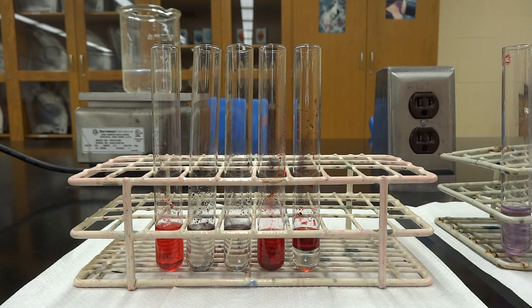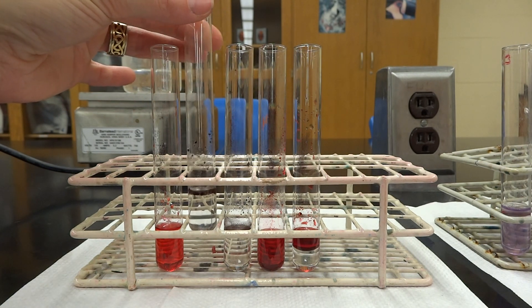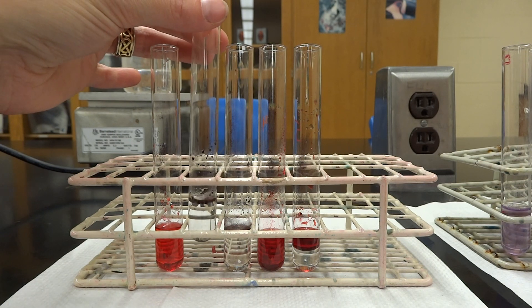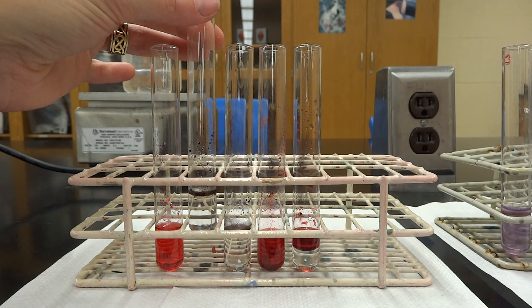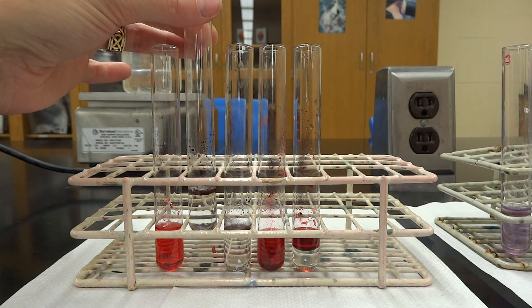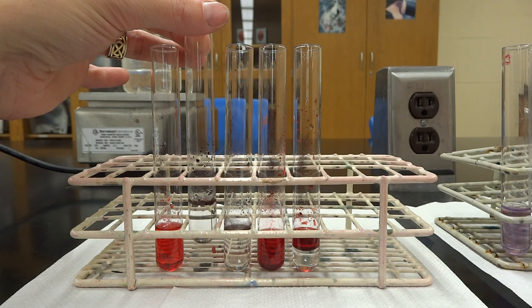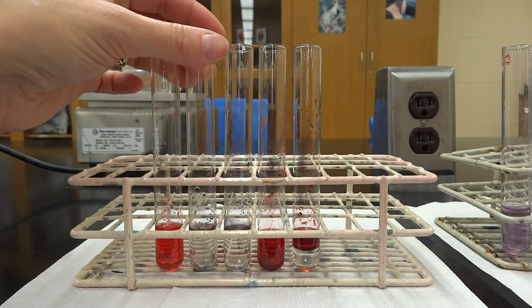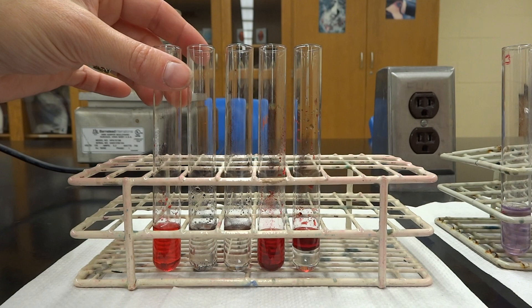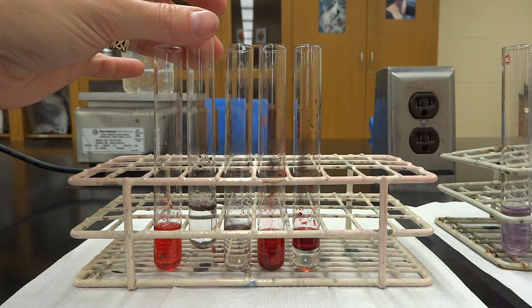Number two, we use water because it doesn't have anything in it. When you use the Sudan IV, it either dissolves into solution or not. You can see number one is very clearly red, which means the powder dissolves really well into the lipid solution.